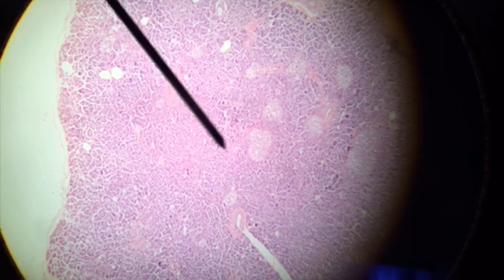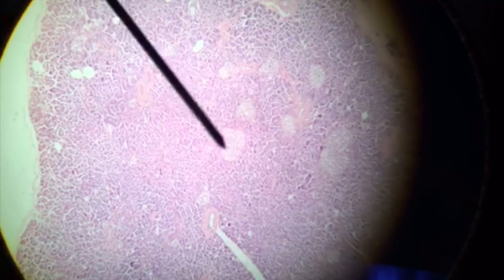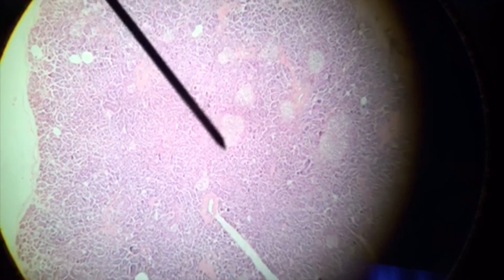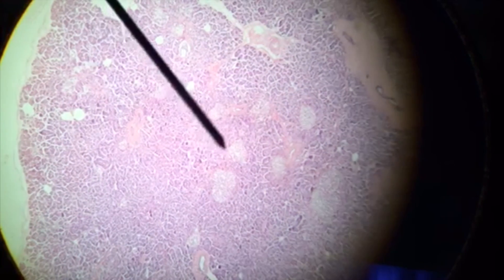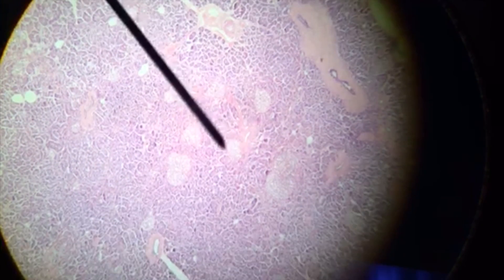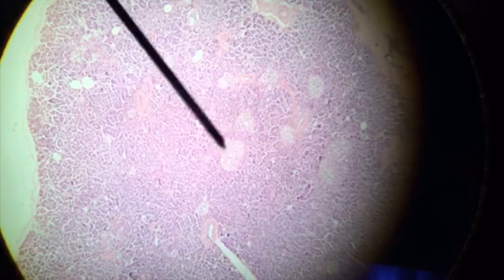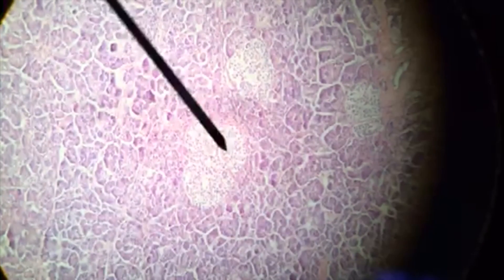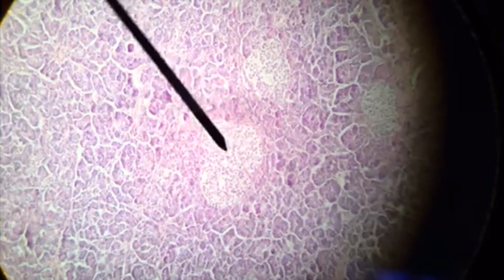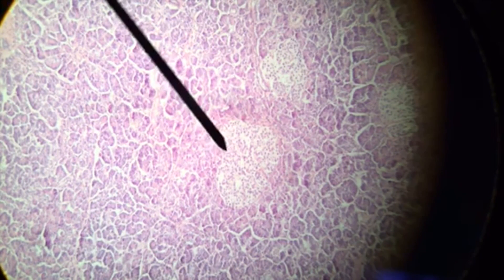We're going to look at the endocrine structures first. The pointer is going to move to the first endocrine structure, which is known as the islet of Langerhans. As I discuss the cells within this structure, we're going to see the pointer move and isolate a few different pancreatic islets. Notice that we can use islet of Langerhans and pancreatic islets interchangeably. We're going to zoom in our magnification a little bit and focus on the four different types of cells found within this islet. While you do not have to differentiate them histologically, you should know what the cells do and what they're responsible for.